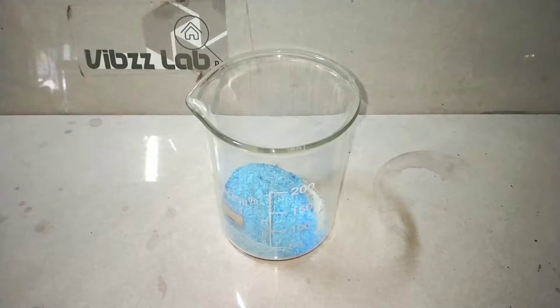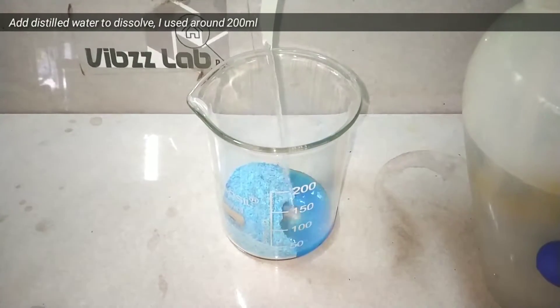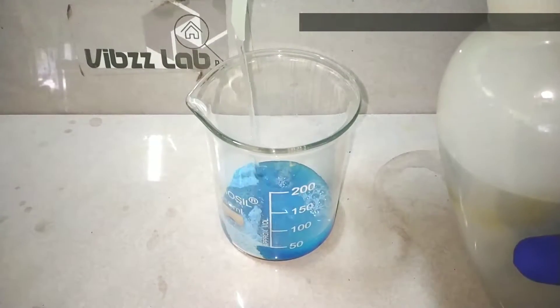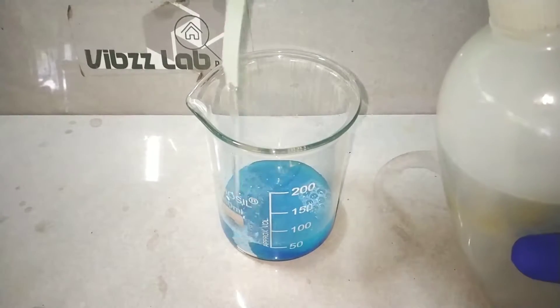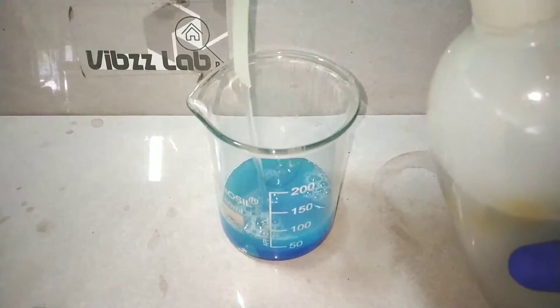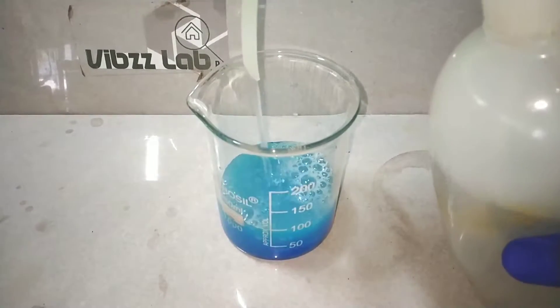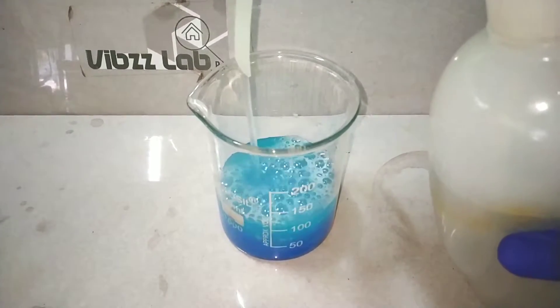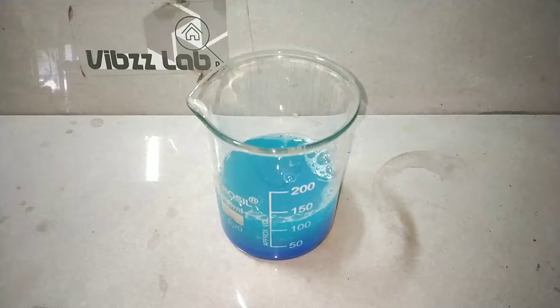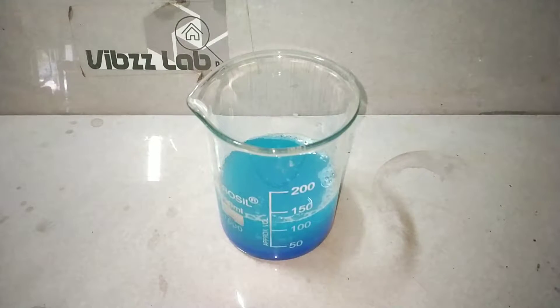I added the powdered copper 2 sulphate into a 250 ml beaker and then added around 200 ml of distilled water to dissolve the copper 2 sulphate. If you still find it difficult to dissolve the compound even after pulverizing it, gently warm the solution to completely dissolve the compound.